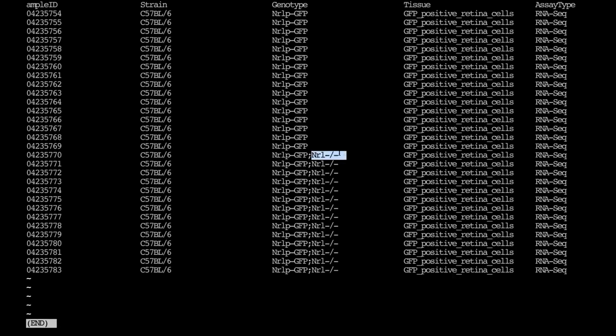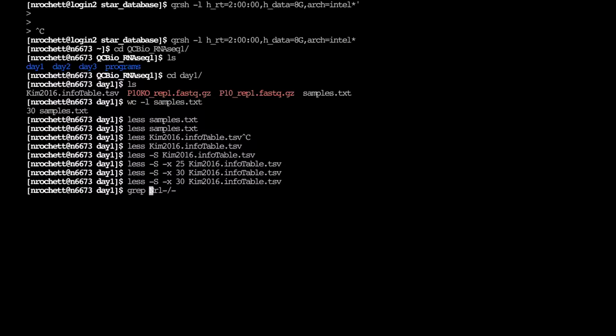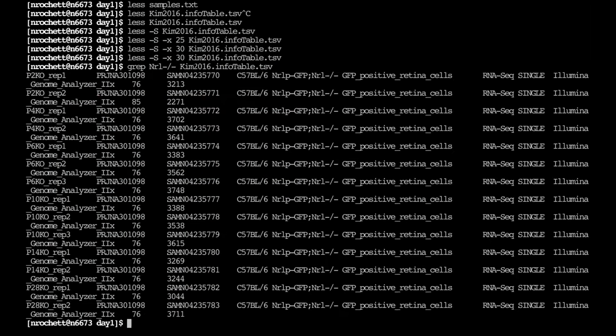And so to count this, we can just, as Mohammed said, we can use grep. And this is just matching all the lines from our file that have this NRL chain of characters in it. So for less, anytime you want the output to be more readable. So here, when I do grep, it just outputs on the terminal. Instead, we can use a pipe character to send it into another command, and in this case, that's going to be less.